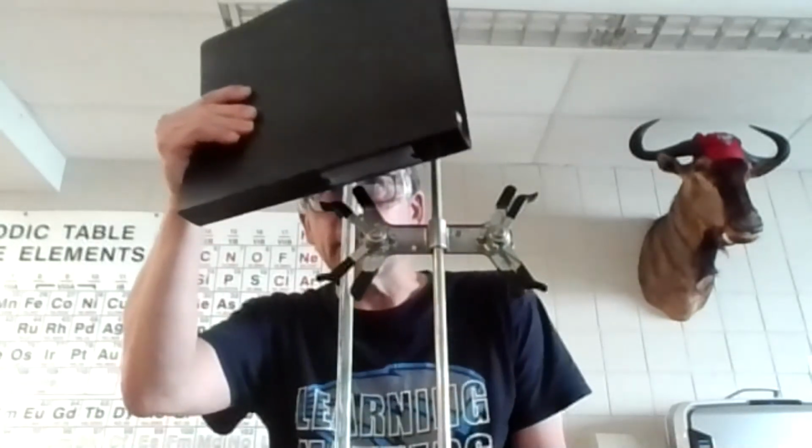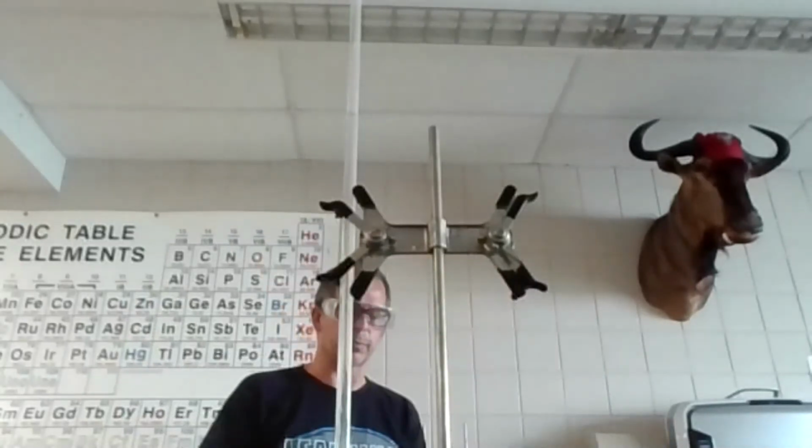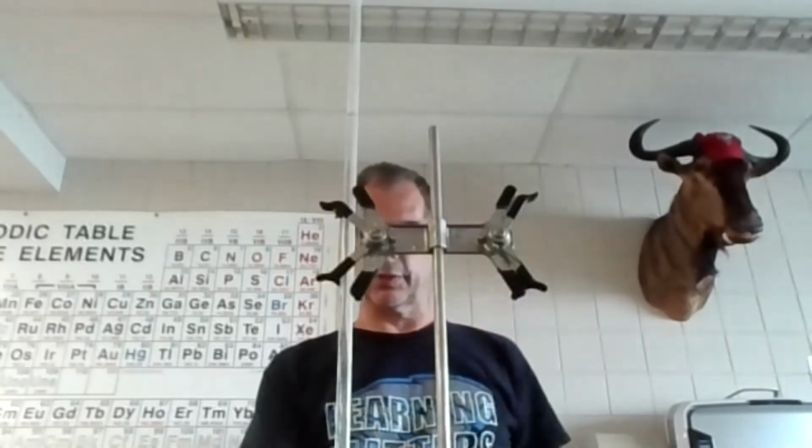Okay, so I'm going to call it 17.00 because it reads to the nearest tenth. So I'm going to estimate one place past that, and it just so happened to be on 17.00.